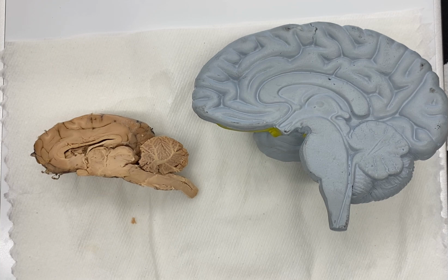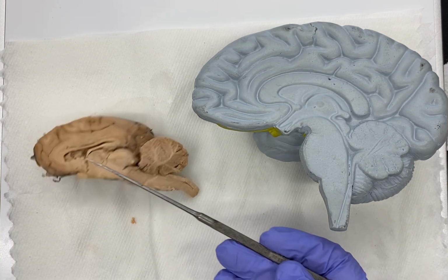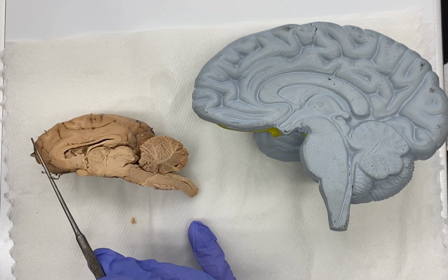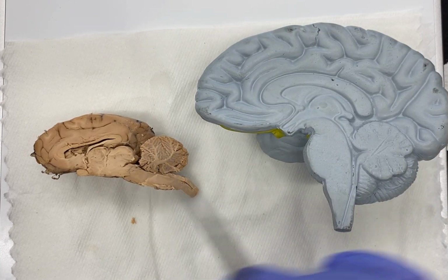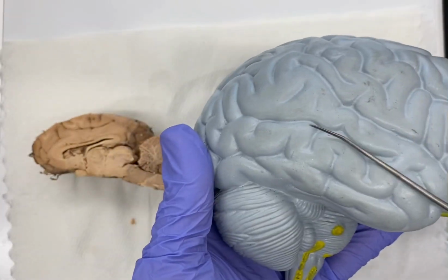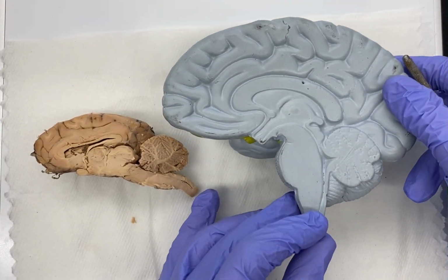So if we look here, and if you've watched some of the previous sheep brain dissection videos, you'll be familiar with some of the anatomical regions and structures and layout of our sheep brain. Just looking initially at our two brains, you'll notice that they look pretty similar, okay? They're not exactly the same, but they're similar. You have the same lobes: a frontal, a parietal, a temporal on the other side, and an occipital lobe. You have the same thing here: frontal, parietal, occipital, and if we flipped it over, you'd have your temporal lobe here. So they're largely the same, but not exactly the same.